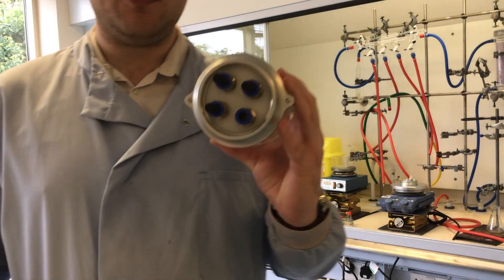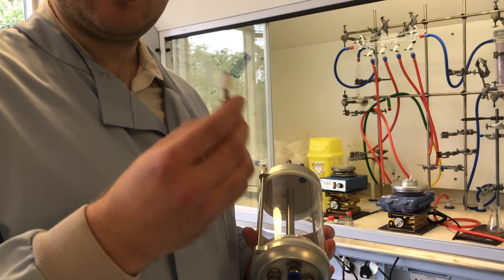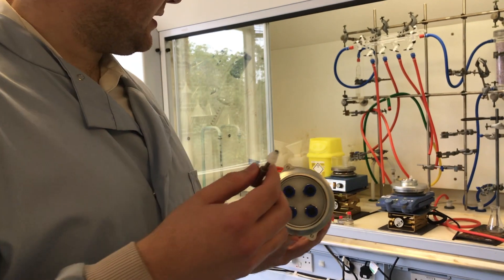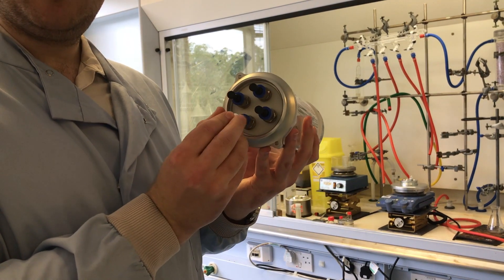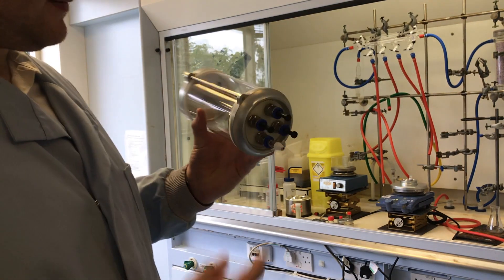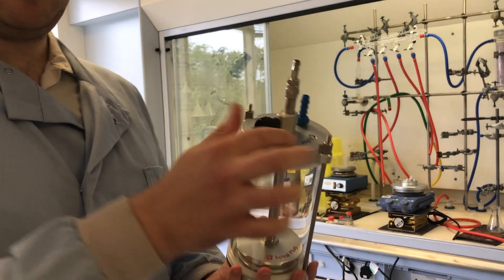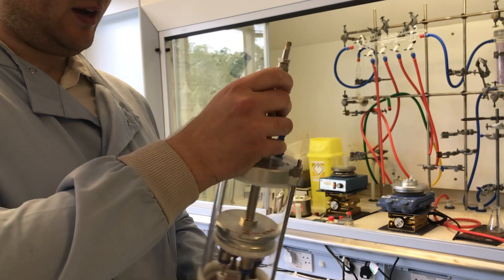As we can see, it's a four position unit here. Once you've picked your vial size, the plug size for your vial, you just push it in like that. Then there's a screw here where you can adjust the height.